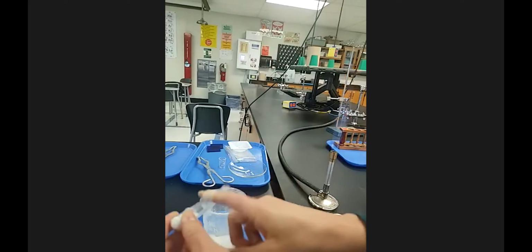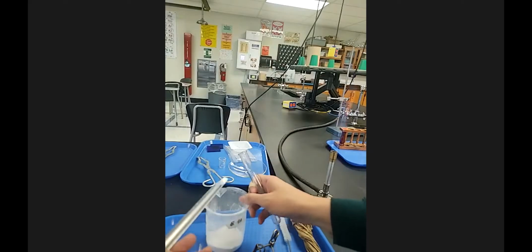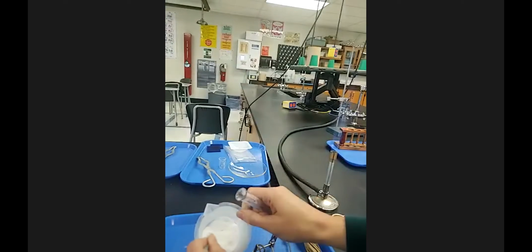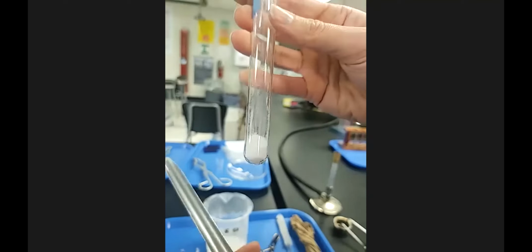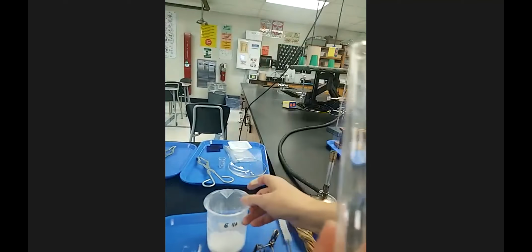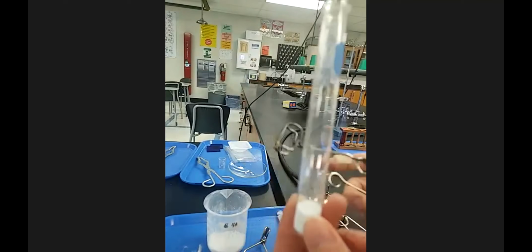Now I'm going to put a little bit back just to show you. Oh wait, now I dumped it all, my bad. Now a little scoop like this would probably not be enough for this reaction, just to visually see it. Would it be enough for the reaction to occur? Absolutely. But I'm showing you that this is qualitative. We're not massing anything, and that's perfectly fine because we're just classifying reactions and trying to see what happens macroscopically with the substances.